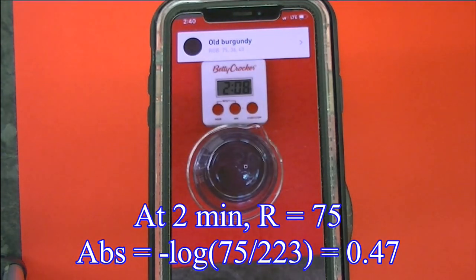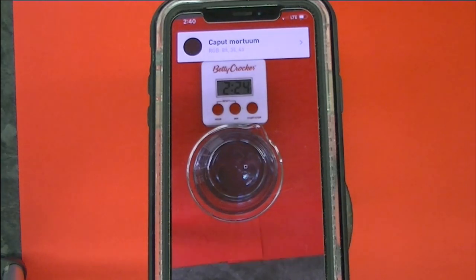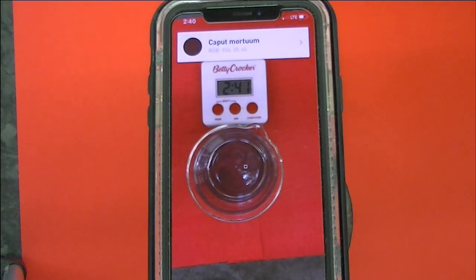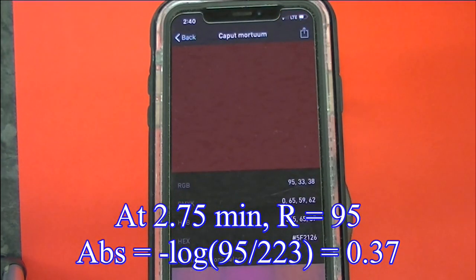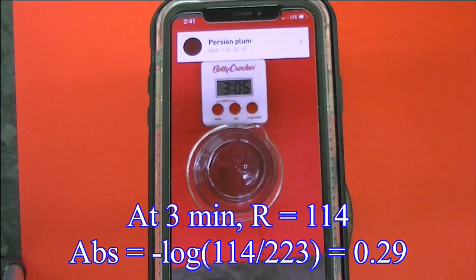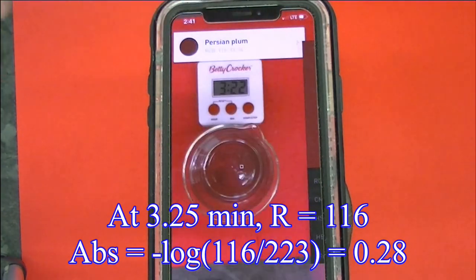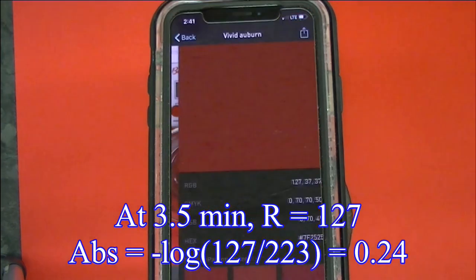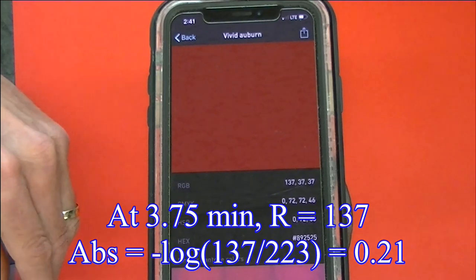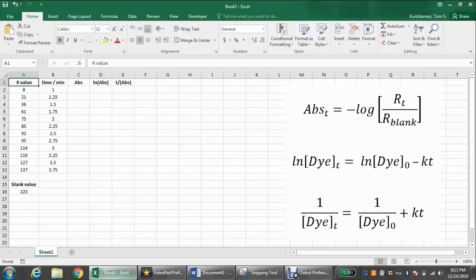Let's watch and record the data as the reaction proceeds. Okay, we're going to go ahead and analyze the data.